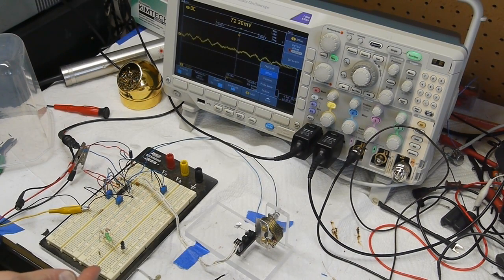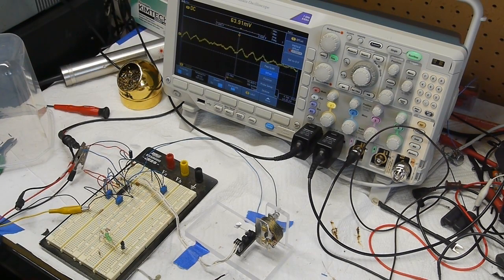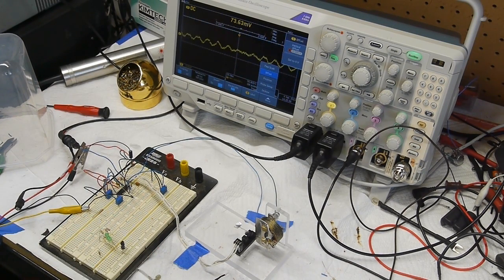With better construction technique to eliminate some more of the noise and also really high low-pass filtering so that the thing will sample over the course of, you know, 5 or 10 seconds to generate a reading, it should be possible to extract a fair bit more precision out of this. So getting down to single-digit micrograms shouldn't be too hard. I tried extending the lever arm here further out, you know, to make the thing more sensitive, basically. But that didn't work very well because it added so much mass to the needle that avoiding oscillation was even more difficult than it already is.